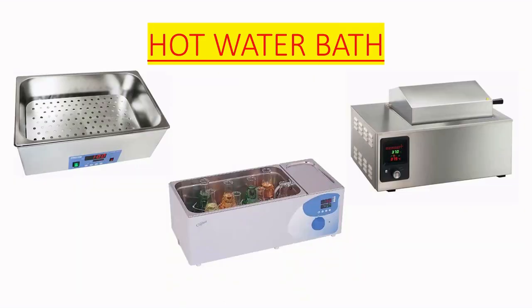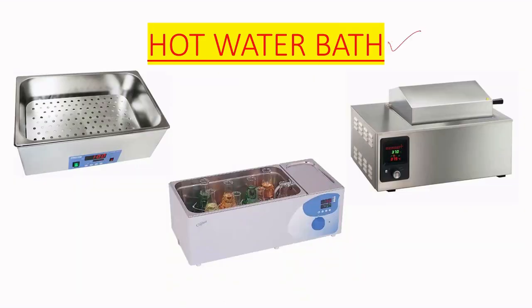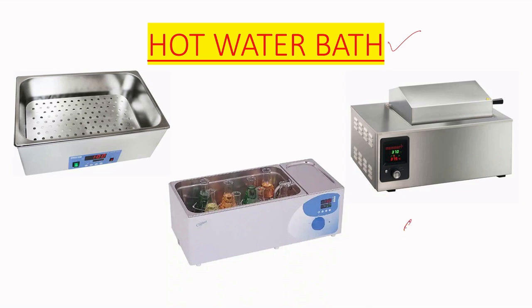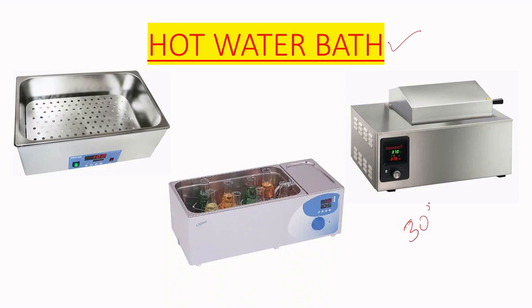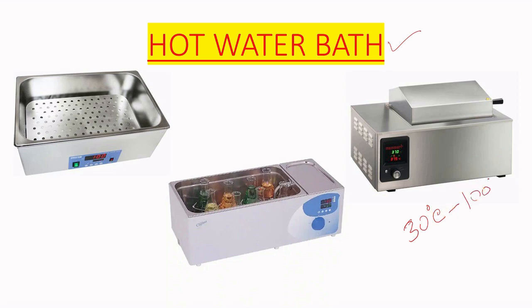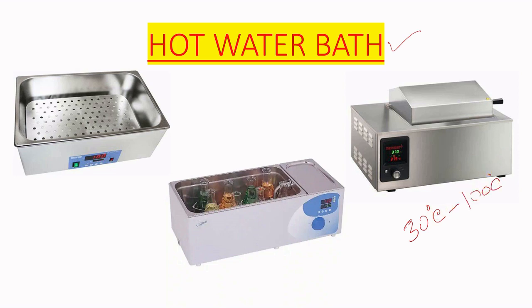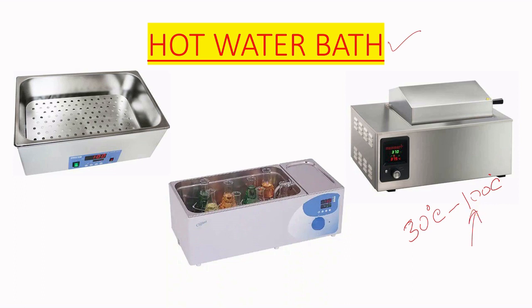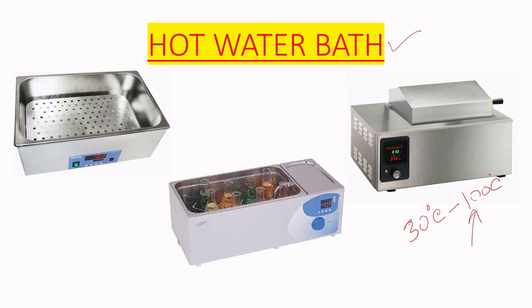The next equipment is the hot water bath. The hot water bath is mainly operated in a temperature range of 30 degrees Celsius to 100 degrees Celsius.